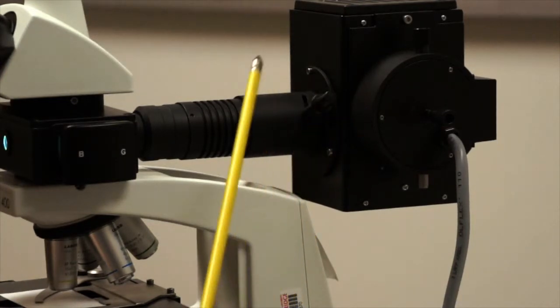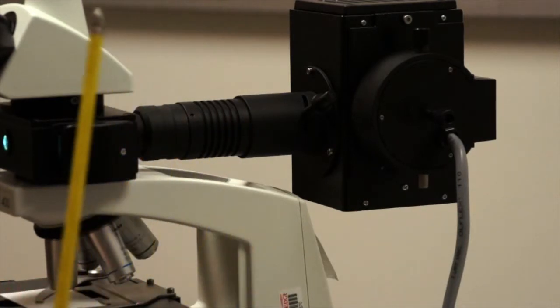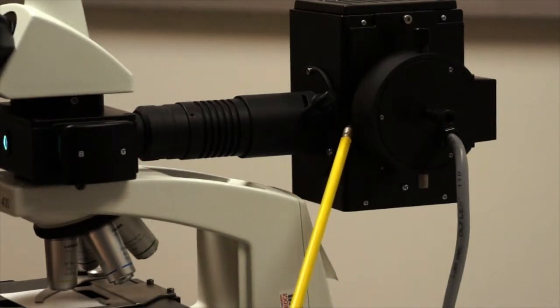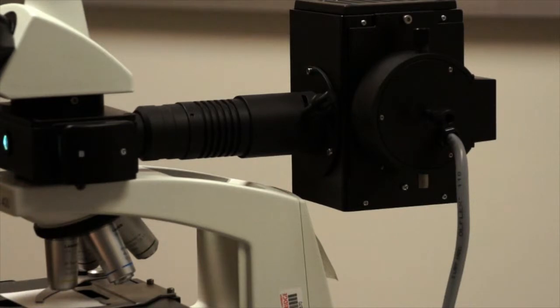We'll look at a graph on the screen later that shows you what's called the emission spectra. The amount of light put out by this bulb is a very high amount of light across a varying number of wavelengths. And that's important because when we do fluorescence microscopy, we have to use different colors to illuminate our specimen. We'll discuss more about this later.